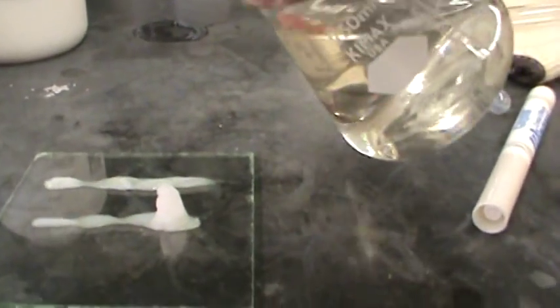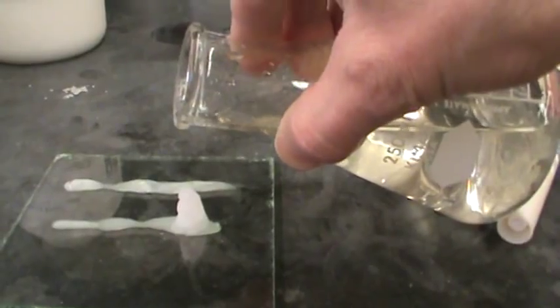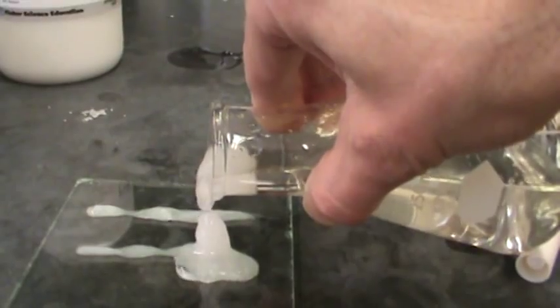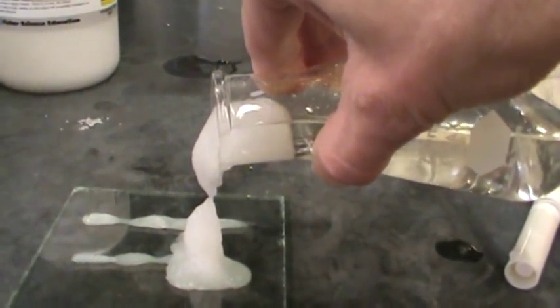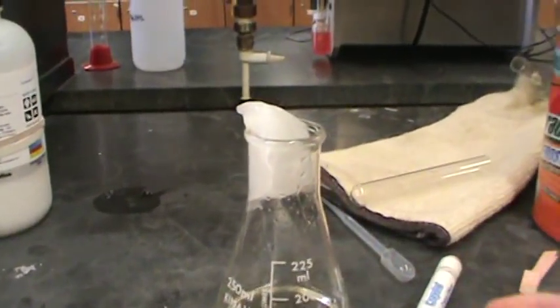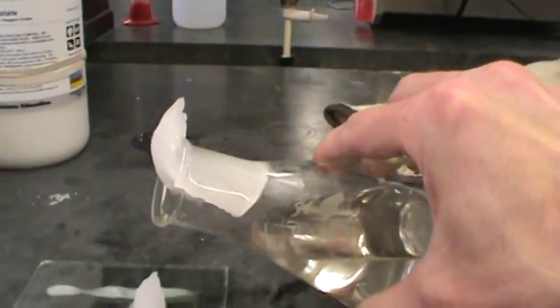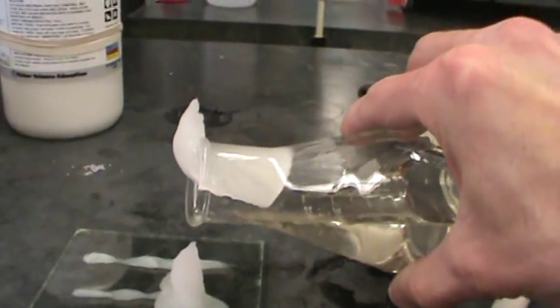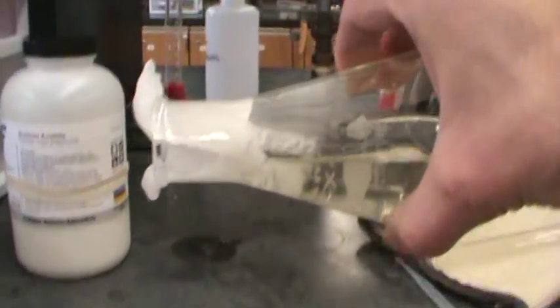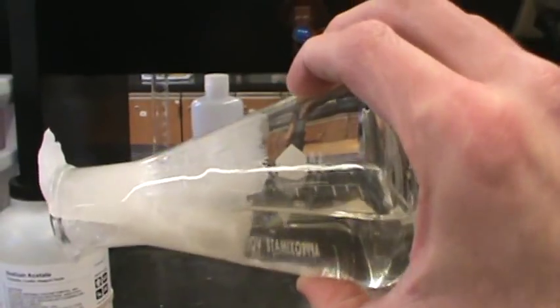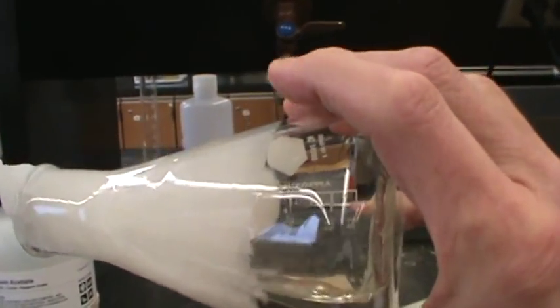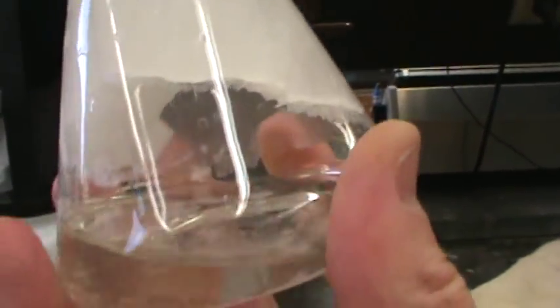I'll just go ahead and pour this right on the top. See what that looks like. Oh, look. You can tell that it got into my beaker. Oh, there it goes. See that at the top? I'm going to try to pour it out this way here. Let's see if I can pull this off. There we go. And, of course, it got into the beaker as well. So let's just go ahead and watch this crystallize right through the beaker. Looks very much like those crystal effects markers that I was talking about before.